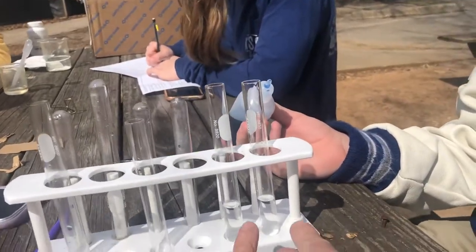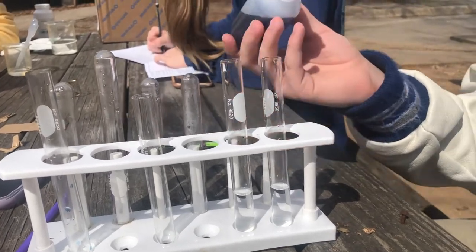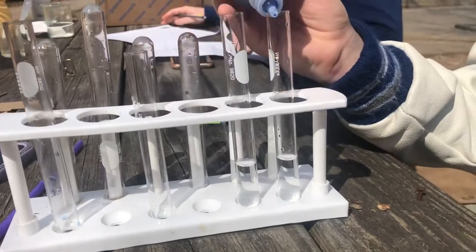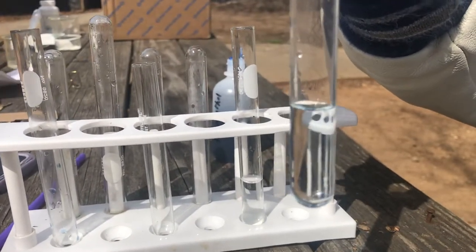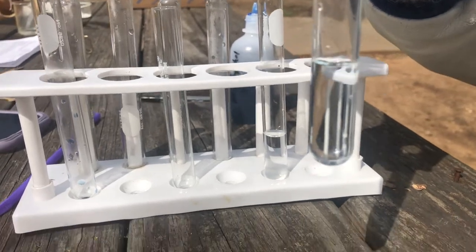Here are two test tubes that have just plain water. We're going to add a drop of what's called bromthymol blue. He's going to add it to the first test tube, and we're just going to give it a little swirl. With that bromthymol blue, it's a very, very pale blue color — not nearly as dark as it was in the bottle, but it is still blue.